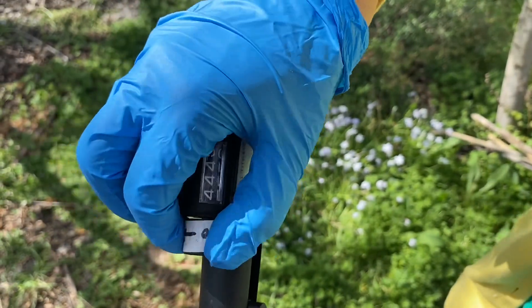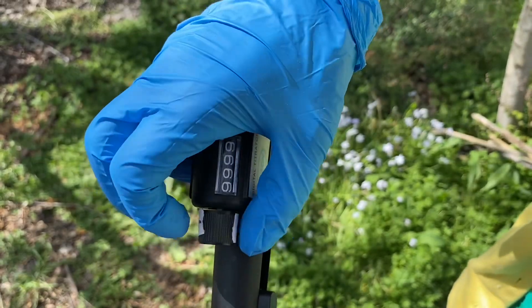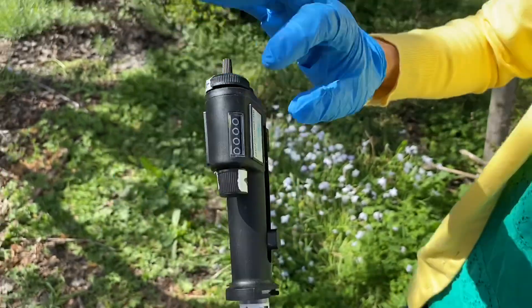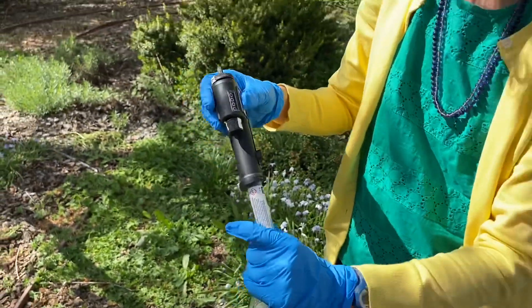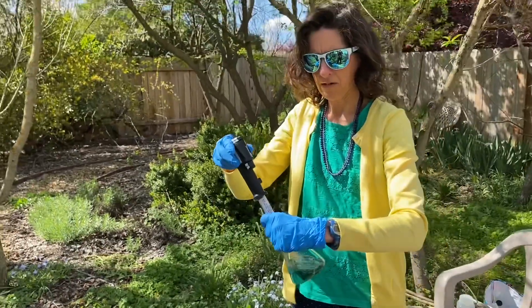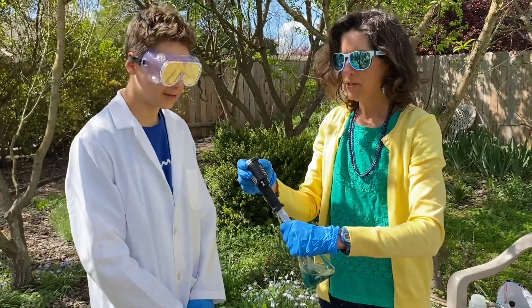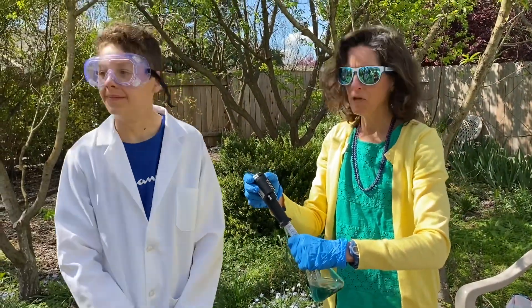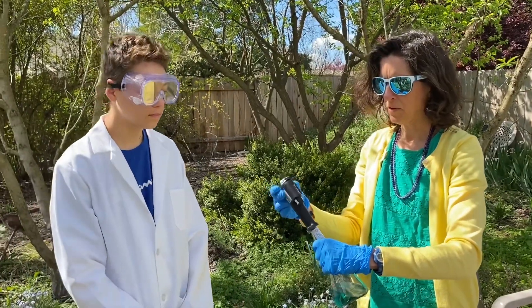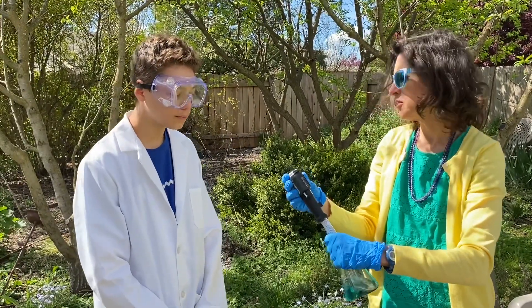Before we get going, I almost forgot to zero. So we want to zero our titrator. I'm going to turn it — it may not look like it's doing anything, but you just have to trust that it's working. There it goes. All right, we're at zero now, so now we can really start our titration.